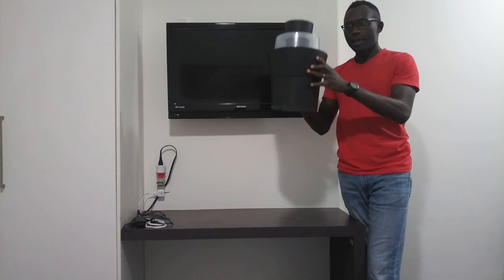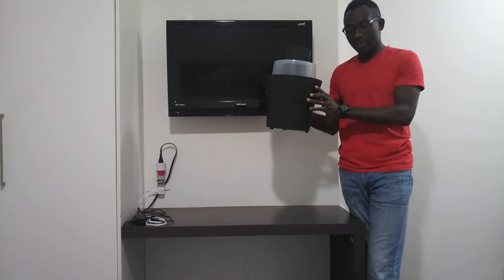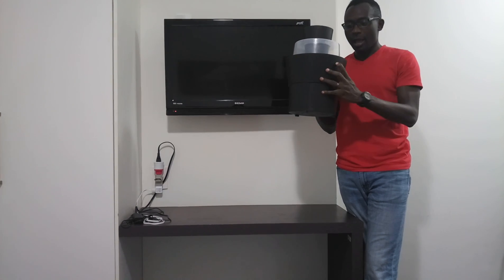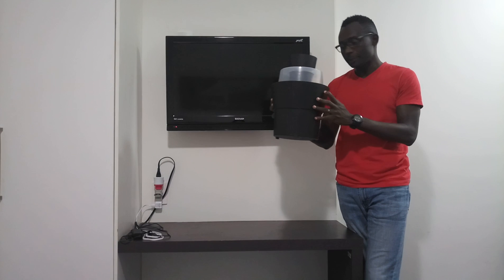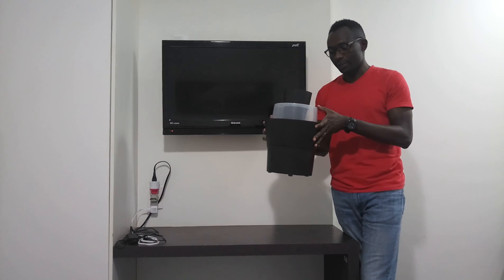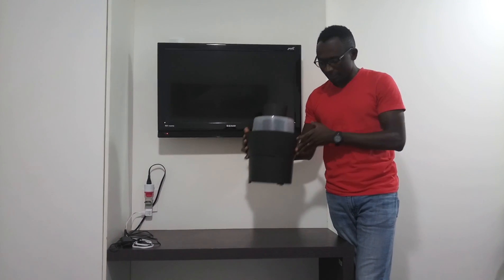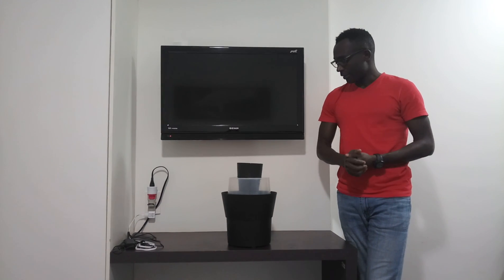The trap sits like this out in the field and you can now start sampling your Aedes aegypti mosquitoes. The trap is available for sale at Biogents, and also in the United States through BioQuip, which is an agent of Biogents. Starting in 2017 it will also be available directly in Brazil. It's very easy to set up and works fantastic.